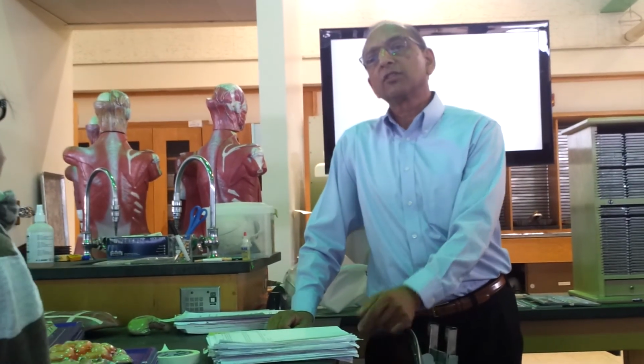So what you need to do today is first take out the microscope and study these slides, because they will not look the same.